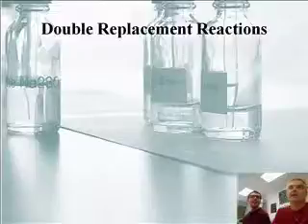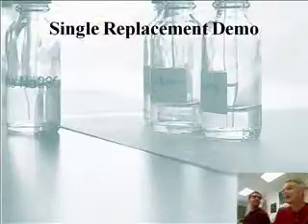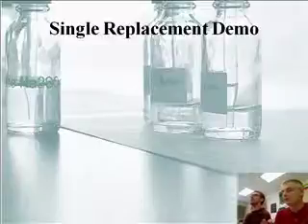Yeah, that's true. Okay, I think we should probably do a demonstration. We probably should, so that you can get this idea and see what it actually looks like. We get to play with silver. Silver! Woo!